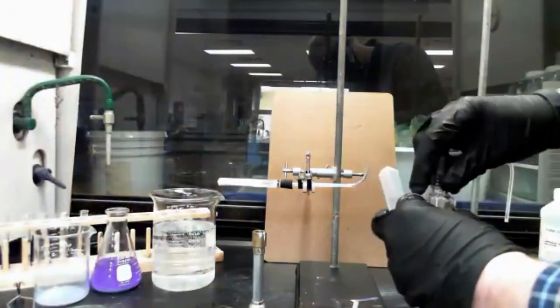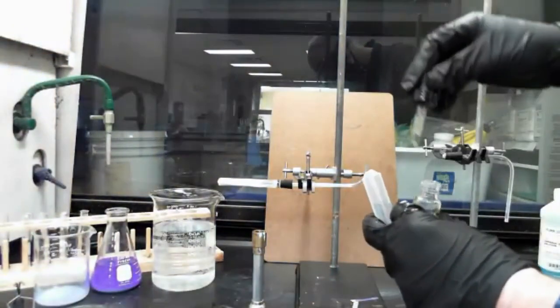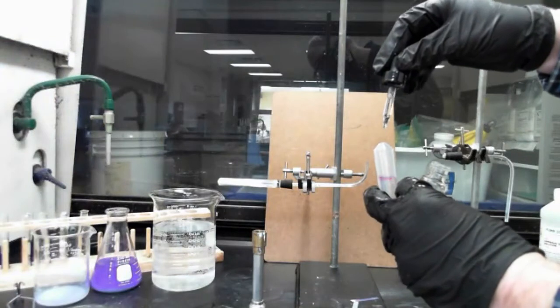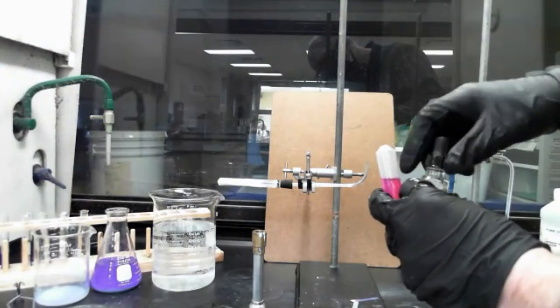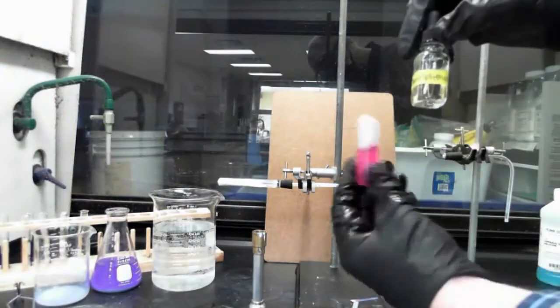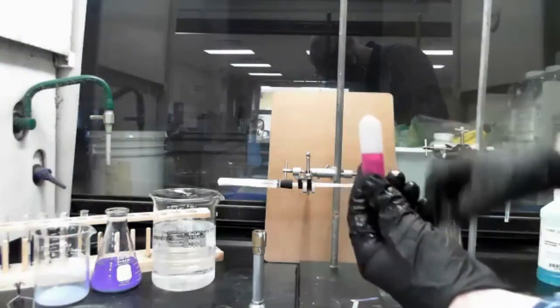And then what happens when we put phenolphthalein in this water? All right. The phenolphthalein that's normally colorless turns pink.